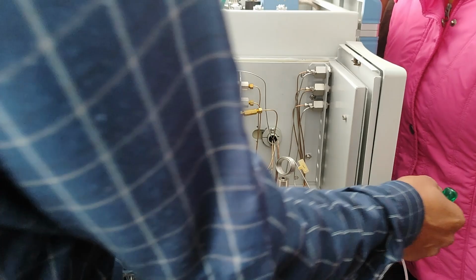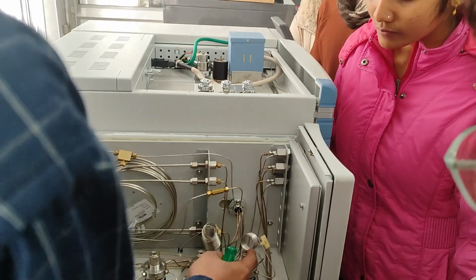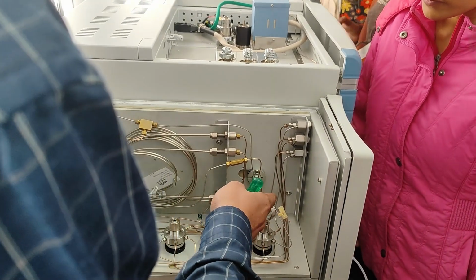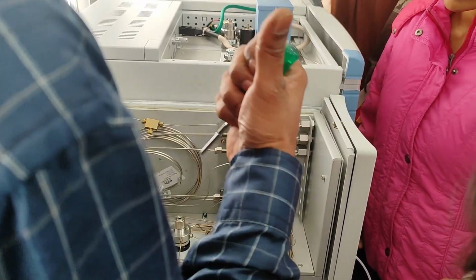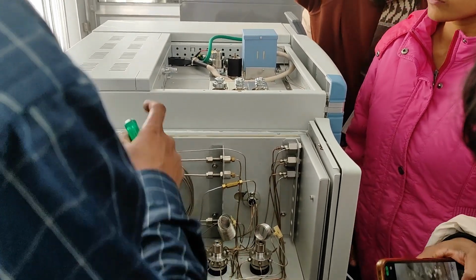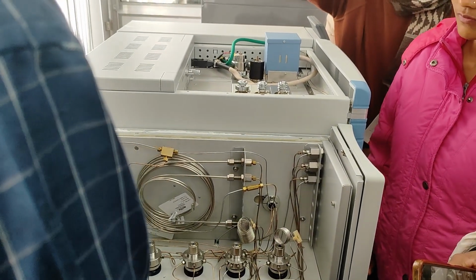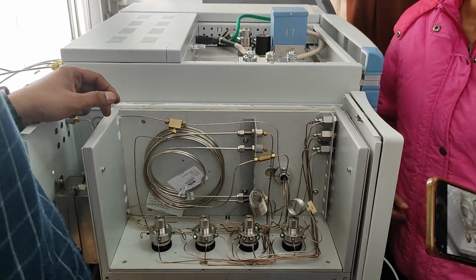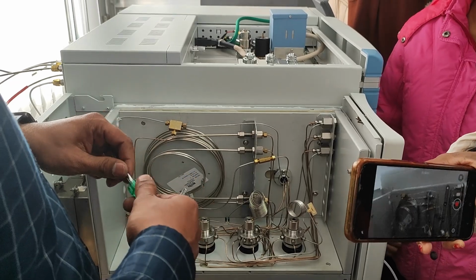So if you are injecting a sample, the sample goes through this loop, fills the loop, and purges the existing content inside the loop. Then when you press the start button, the loop's part will be injected. Okay. And the outlet bubbles will confirm that your sample is going inside. Injection time is 15 to 20 seconds.